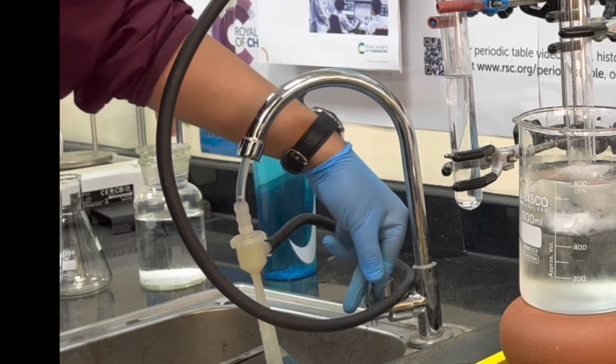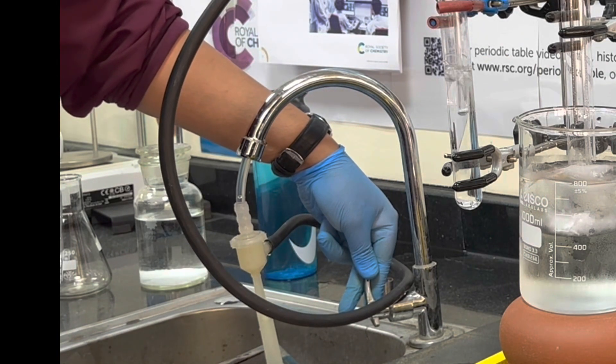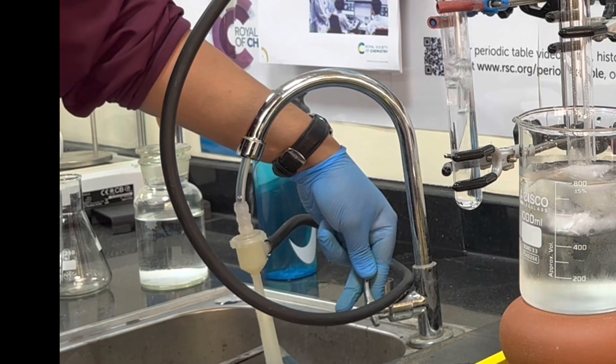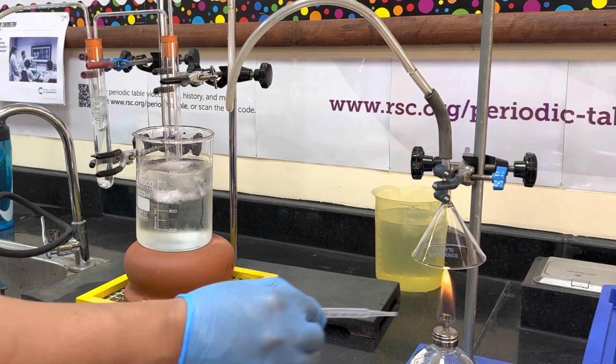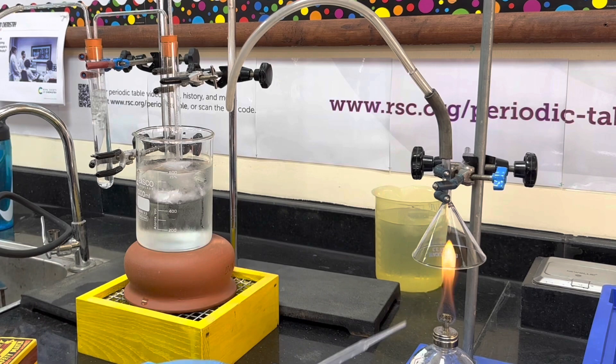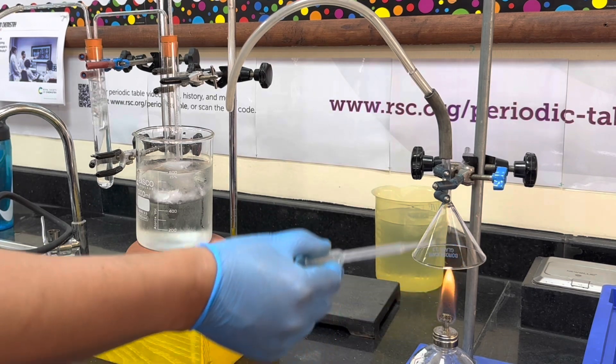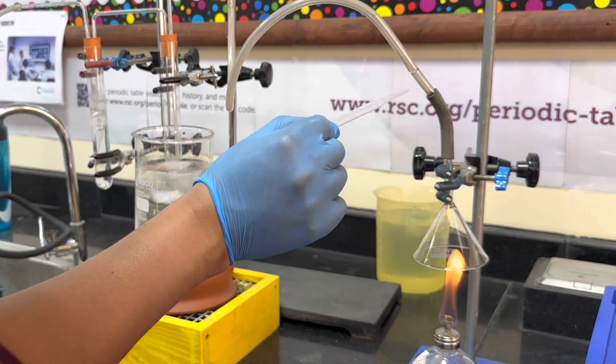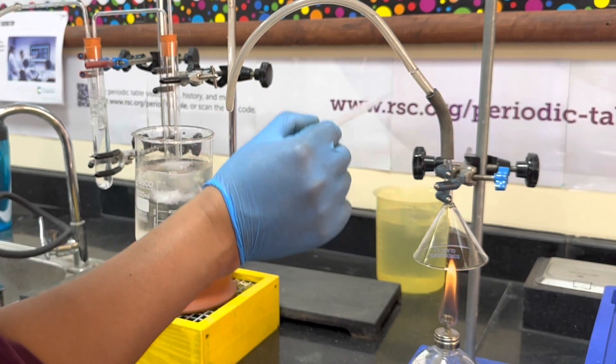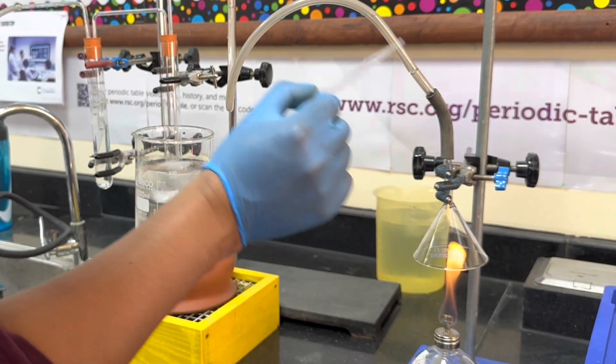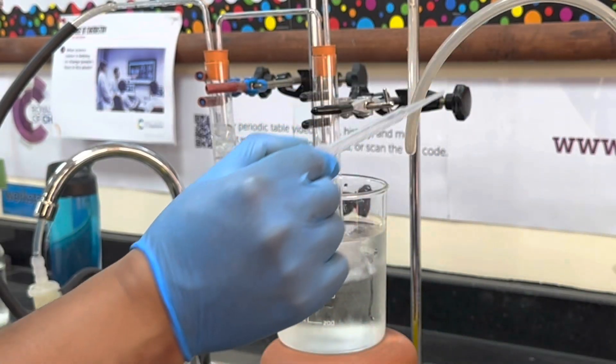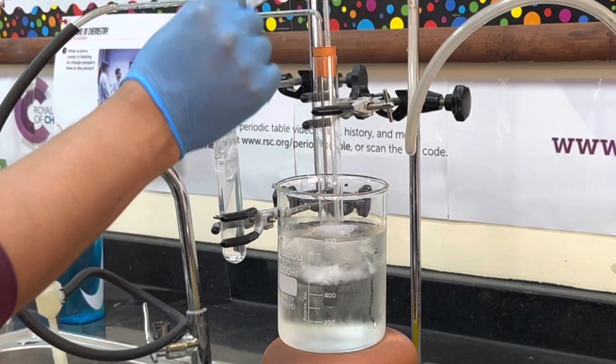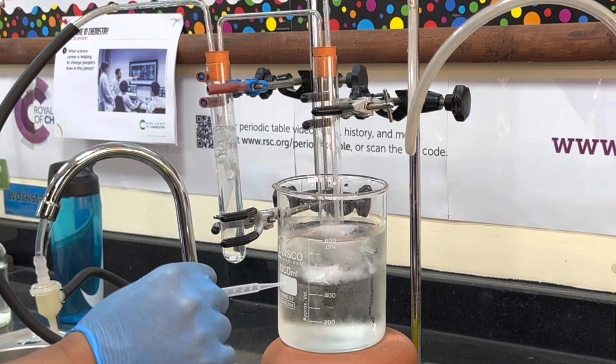Carbon dioxide and water. So you've got plenty of oxygen reaching this fuel on the right-hand side - it's ethanol in a spirit burner. The gases that are released from the burning fuel are being taken through this suction pump. It's a sealed set of apparatus.